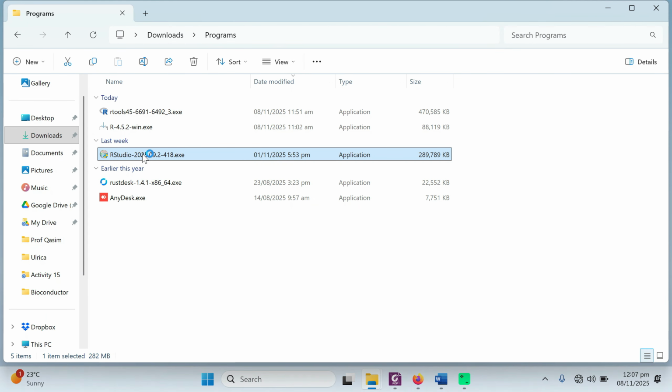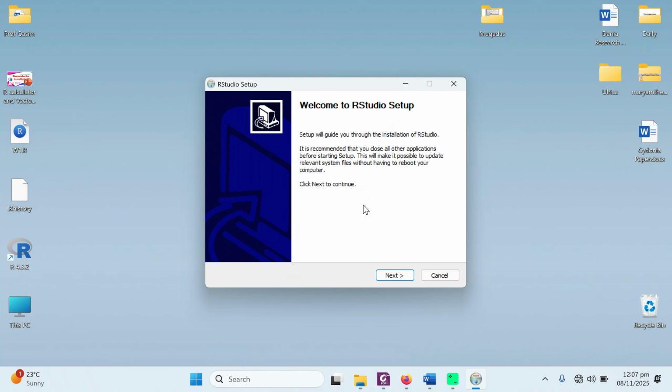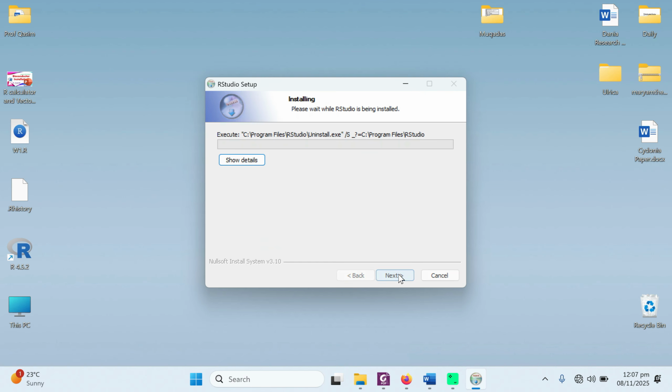The last step is installation of RStudio. Click on the yes button and it will start initiating your program. Click on next, install. So the main packages are the R software and then the RStudio software. RTools are basically the supporting packages which are needed to run R and other affiliated packages.